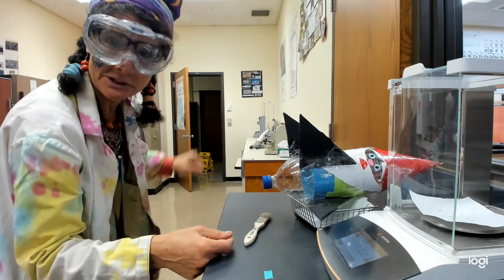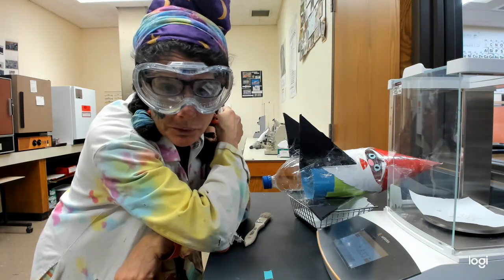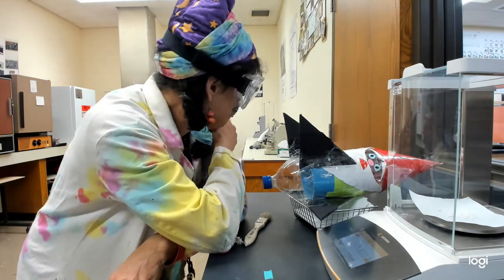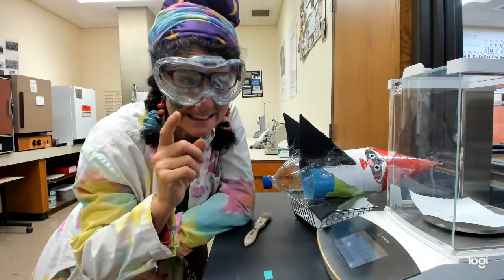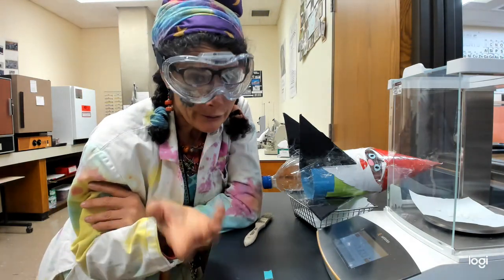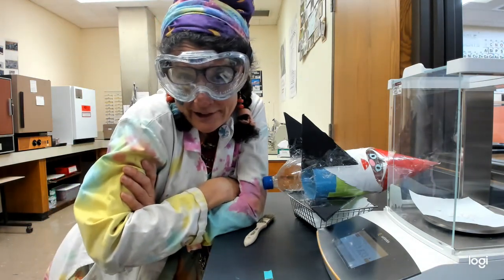Gnome over there was doing melting point. He got 126. It was actually a range, 125 to 128. It's pretty good. Melting point of aspirin is 135. So we're a little bit low, but the melting point of salicylic acid, the starting point, is 159 to 160. So we definitely made something. Question is, how pure is it? And that's what you're going to figure out.